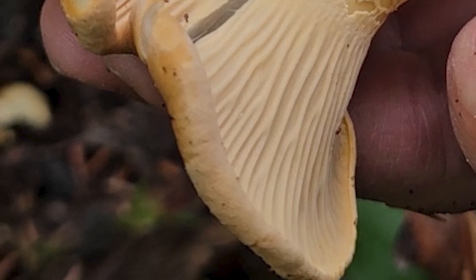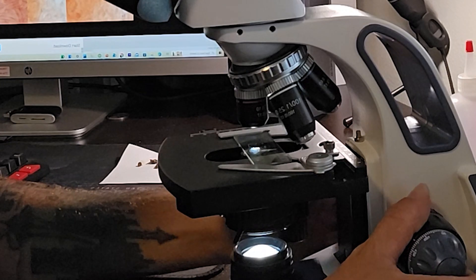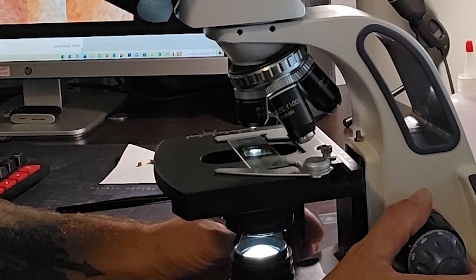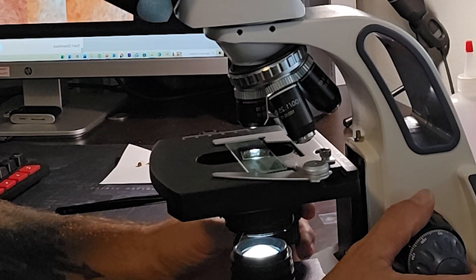It's a structure produced by the fungus to produce basidia. This little fold underneath the cap is not exactly like a little piece of paper like a lot of gills on fleshy mushrooms, but these are definitely producing basidia on them. So I'm going to take this razor blade and cut a really, really thin little piece off the edge of that gill — super thin, the thinner the better. I need to be able to put this on a microscope slide and put a drop of KOH, which is a wetting agent. You could just use water or rubbing alcohol and it's going to rehydrate this piece of fungal tissue, which is going to make it quite a bit bigger. And if it's big enough, you won't be able to get the cover slip down tight on it — there'll be air bubbles under there. When you're looking through a compound microscope like the one I'm using, you have to have a super small piece of material so that a cover slip can lay on top of the microscope slide, sandwiching that little piece of tissue in that liquid so that you can see through it. The light comes from underneath and it actually needs to shine through that material in order to see those fungal structures, so it has to be super duper thin.